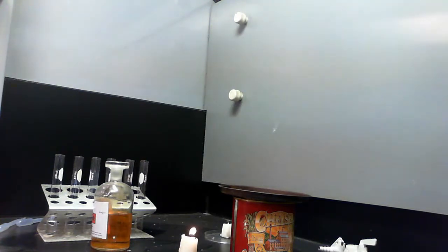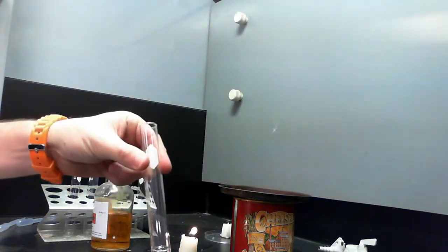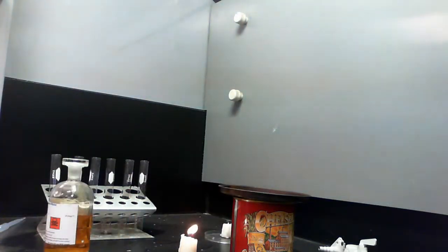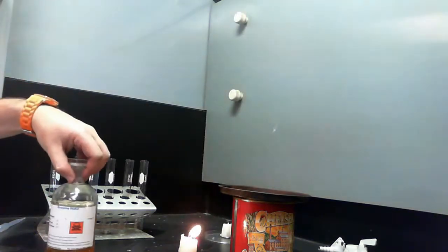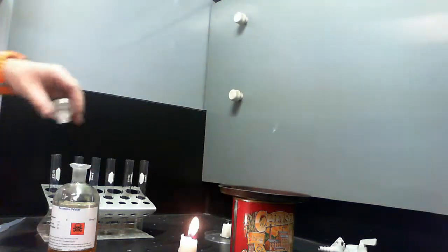Okay, the other reaction that I really want to look at today is, this is cyclohexane again, and I'm going to add a chemical to it called bromine water. Bromine water is just Br2 dissolved in water, so it's not quite so fumey and dangerous to use. It's still pretty nasty stuff, so I'm going to use it in the fume cupboard. Like chlorine, it can do serious damage to your lungs, so we don't want to get it out of here at all.